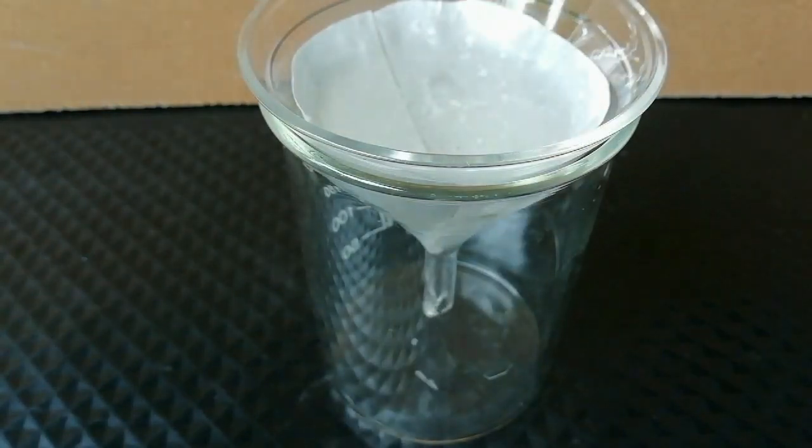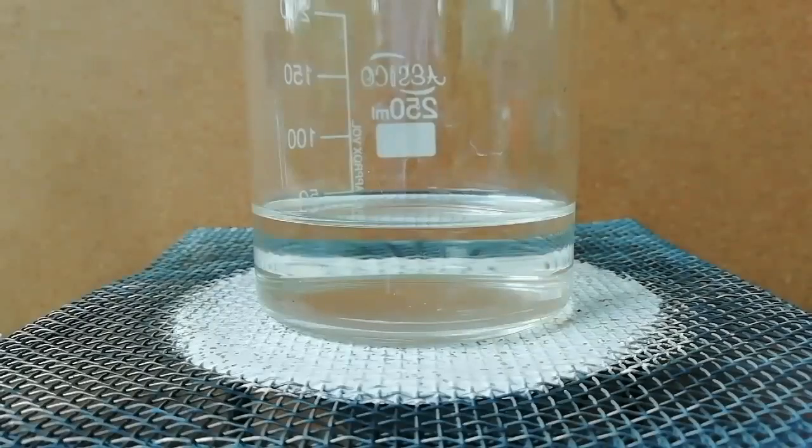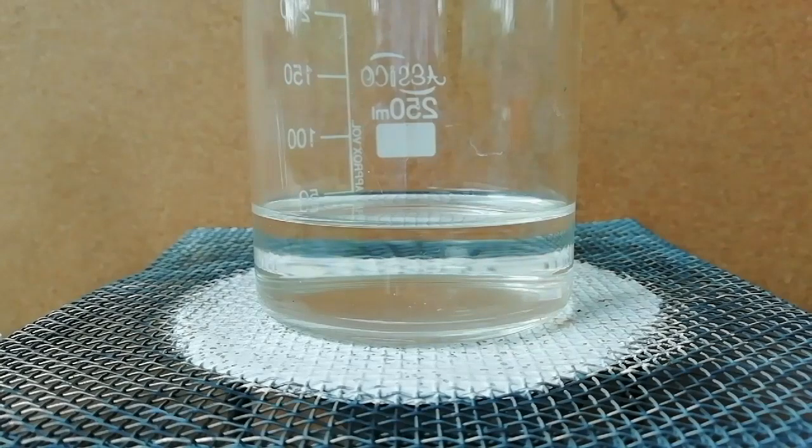After that, the solution was transferred to a 250 milliliter beaker. Now I heat the beaker to remove all the water in the beaker.